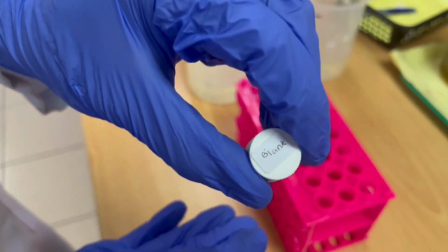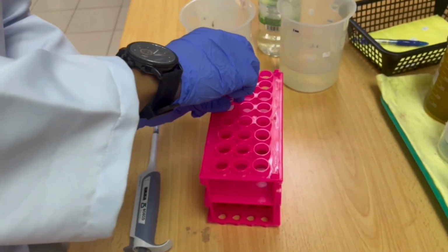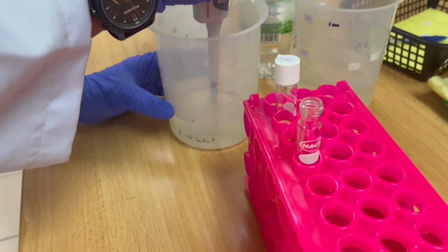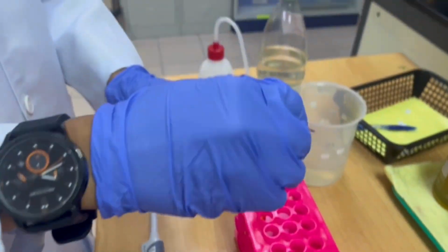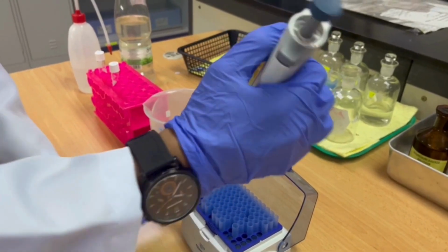I will conduct the chemical oxygen demand parameter. Firstly, we preheat the DRB 200 to 150 Celsius. Prepare the sample by adding 2 ml of water sample using a clean pipette. Hold the pipette at 45 degrees to prevent bubbles. Hold the vial by the cap and invert gently. The vial will get very hot during mixing.